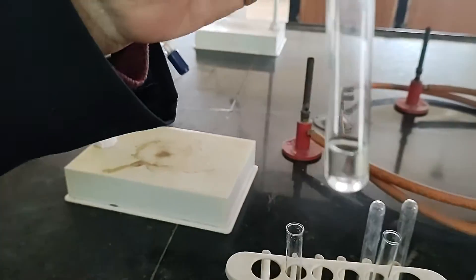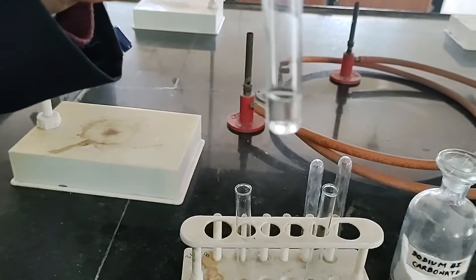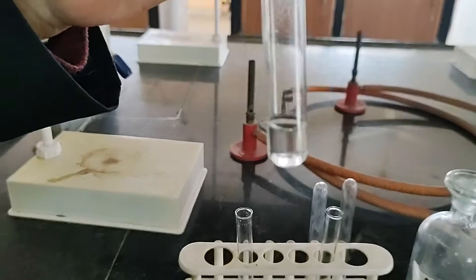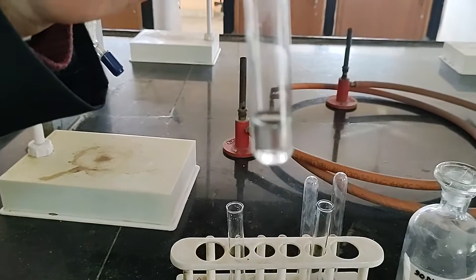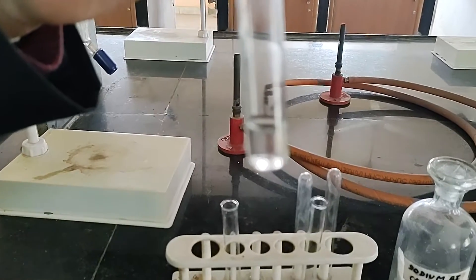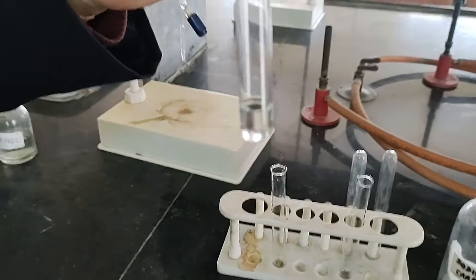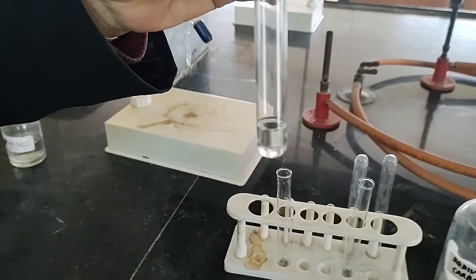This is your unknown organic compound. See this color — it is a colorless liquid compound. It has a smell like vinegar.